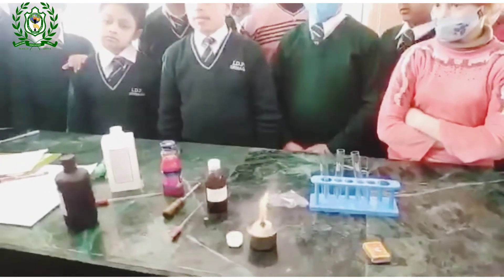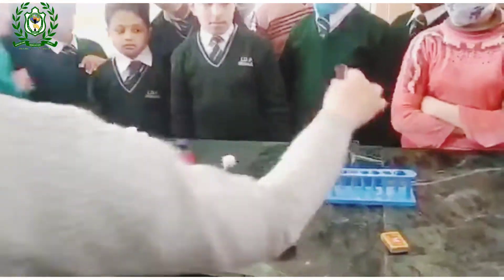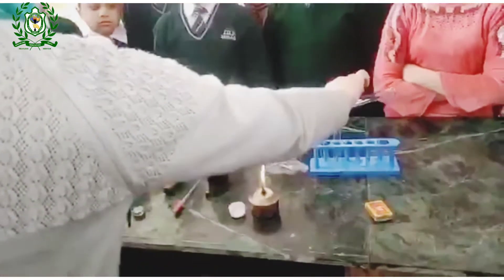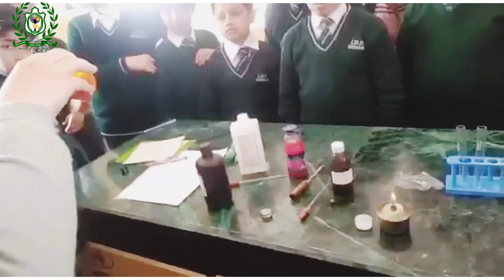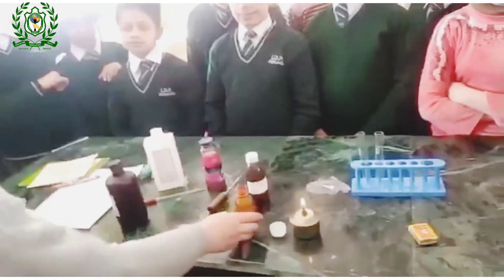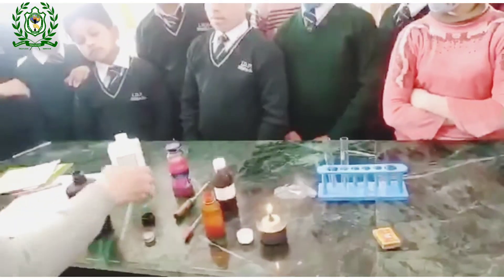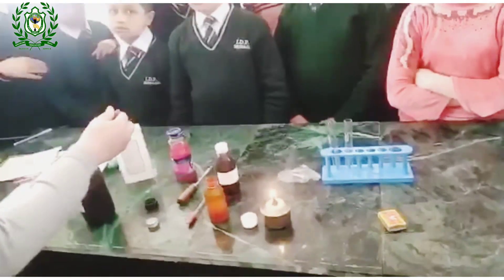This is grape juice. We'll put the grape juice in a test tube. We'll check the presence of sugar in the grape juice. We'll add some drops of Benedict's reagent to it.